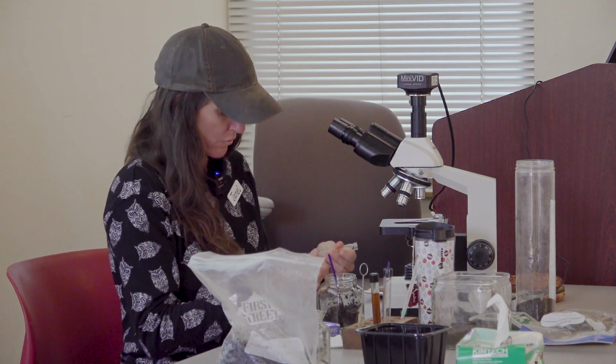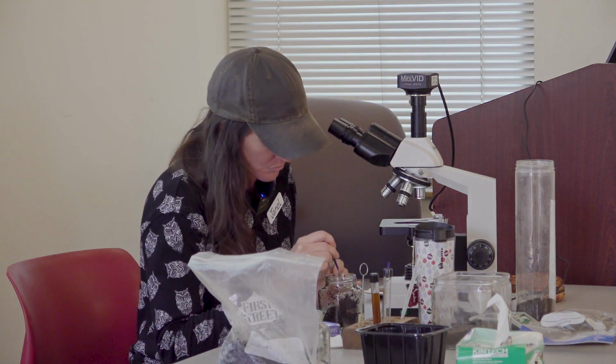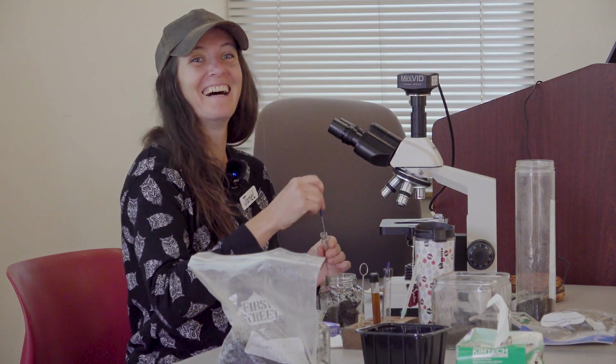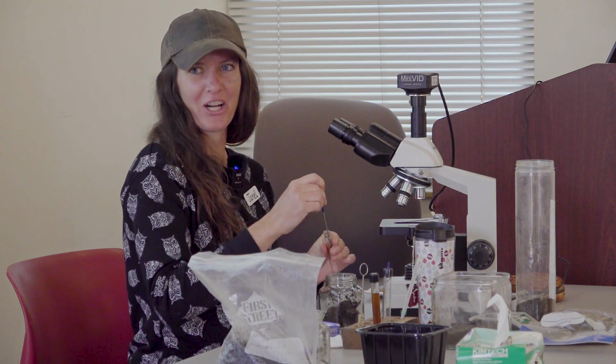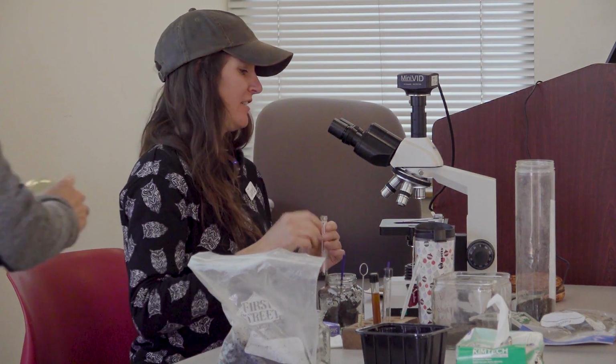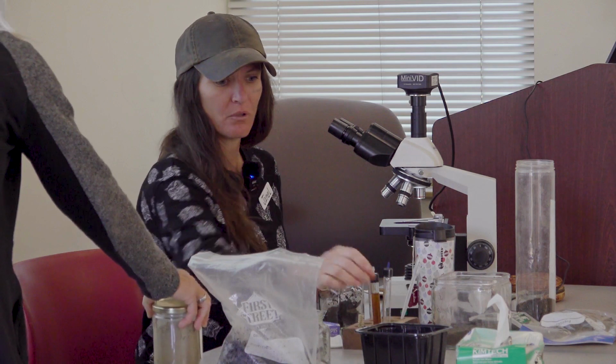And if anyone wants a quick lesson and wants to observe their own sample and use the microscope, you can come up here and do that as well. Pull up a chair. I've got water.